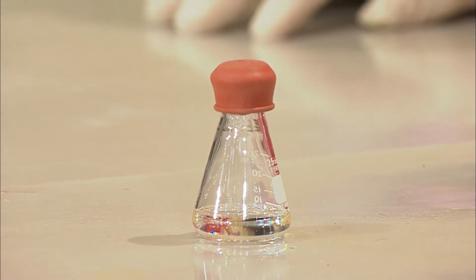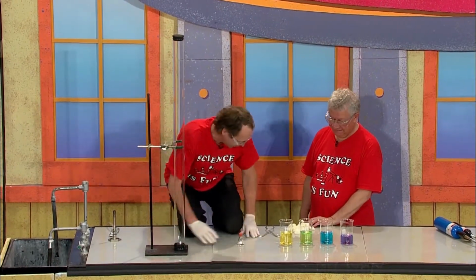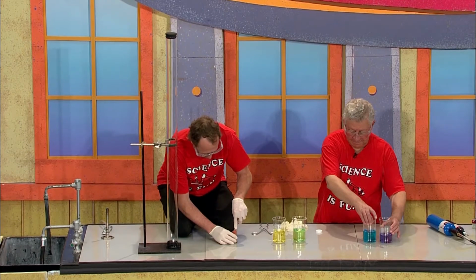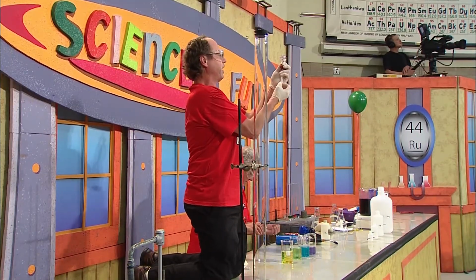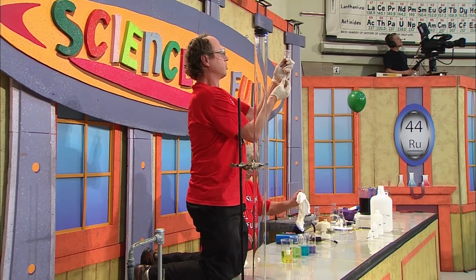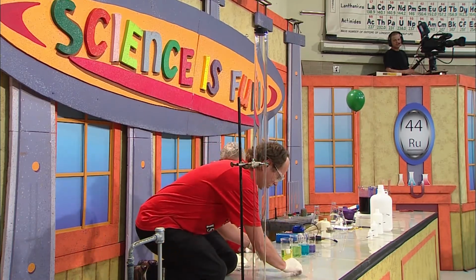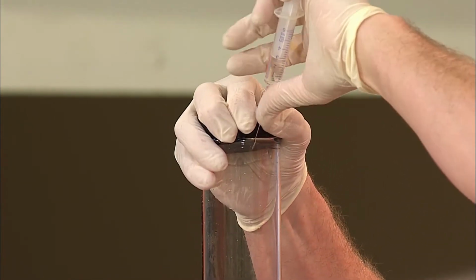So in order to do this, though, I need to get up on the table. And I need my syringe. So I'm going to withdraw some of this carbon disulfide with the syringe so I don't have to smell it, and because it isn't really good for you. But don't worry, it doesn't hurt a bit. All right, so I'm withdrawing a certain amount of fluid from here, and I'm going to introduce it to this large glass tube.